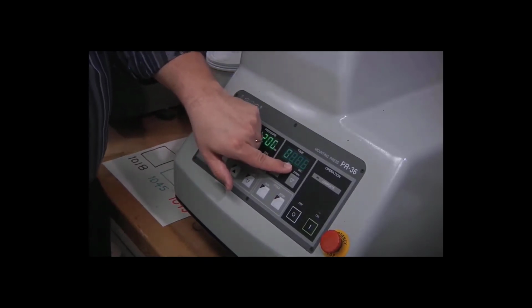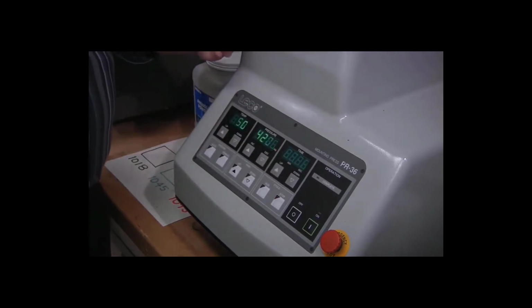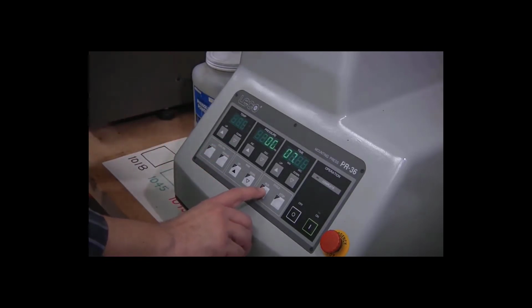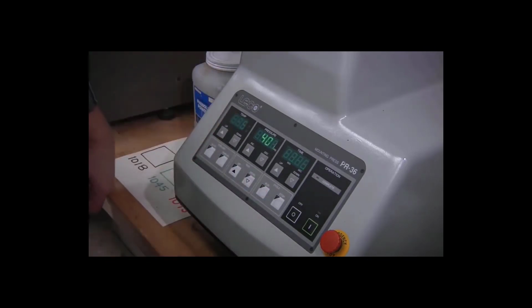When the 7-minute countdown is complete, you'll hear the cooling water start. When it first enters the chamber, it obviously boils on the surface that's 150 degrees C. When the temperature gets back down to 50 degrees C, we'll be ready to eject our specimen. So to begin the cycle, I just have to press run and wait.